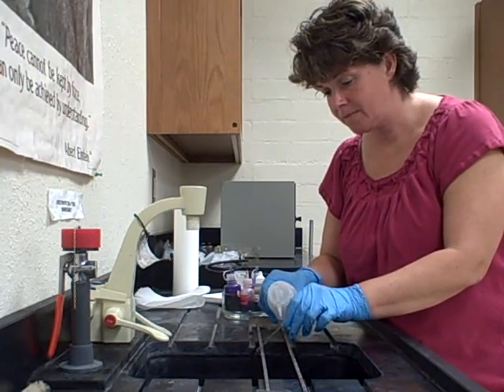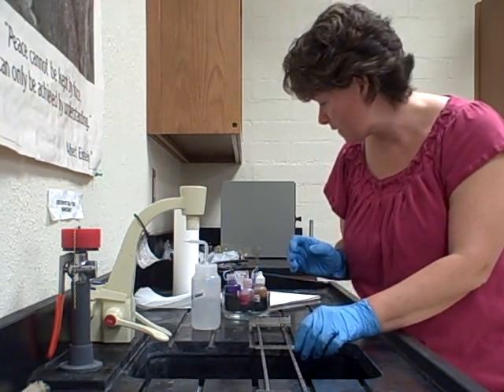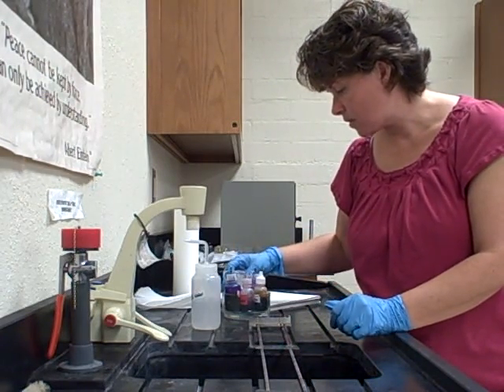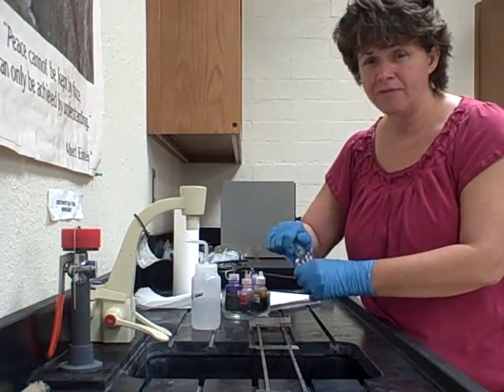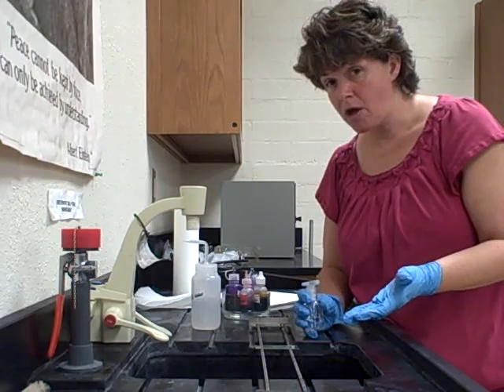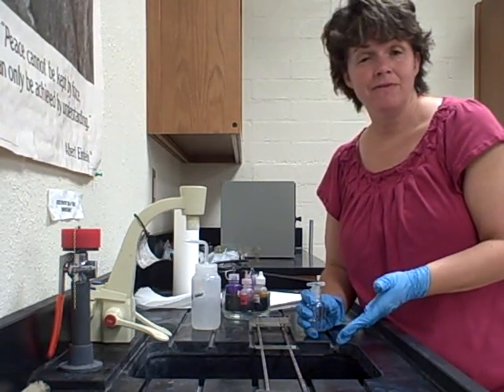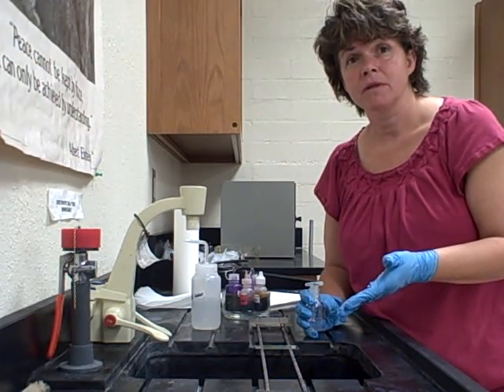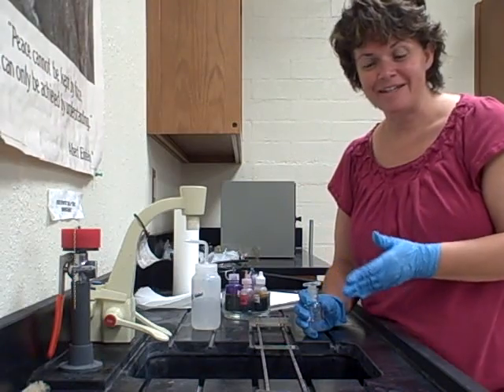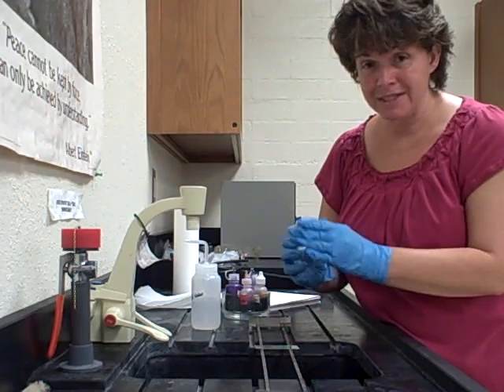After the iodine sits for about 10 seconds, rinse the smear — never spray onto the stain itself. The next step is decolorizing with alcohol. This is the one step you have to be really specific about. If you leave it on too long, you'll decolorize gram-positive bacteria; if you don't leave it on long enough, you will not decolorize gram-negative bacteria.